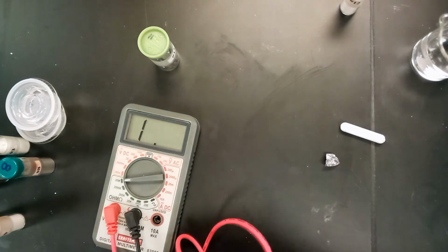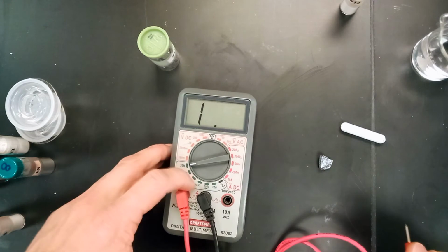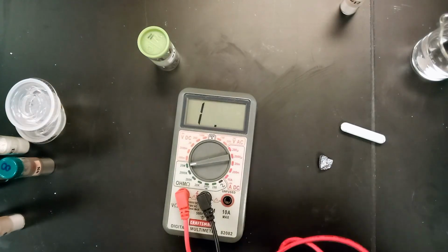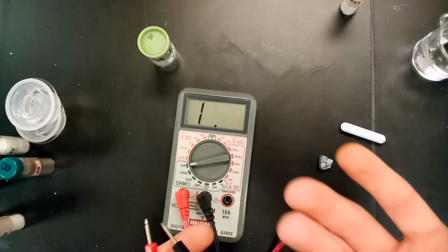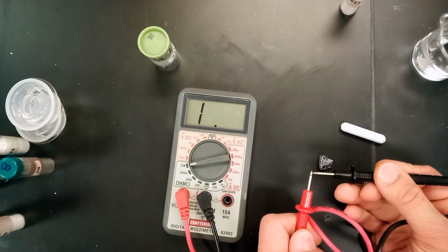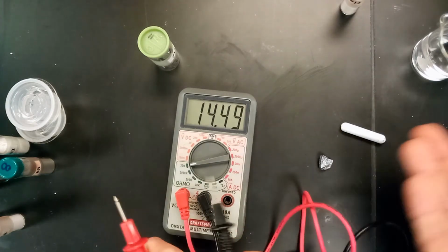The other thing we need to check is continuity or conductivity. So we have our multimeter here, and we've turned it to the ohms setting. I have it on 20 M, which seems to work best for me. It's basically putting the charge through, and it lets the multimeter know whether or not the charge is getting all the way through. So just to confirm this, when you click the ends together, the meter should read something close to 0.00. It's just confirming that there is continuity, and when they're not together, it doesn't read 0.00.